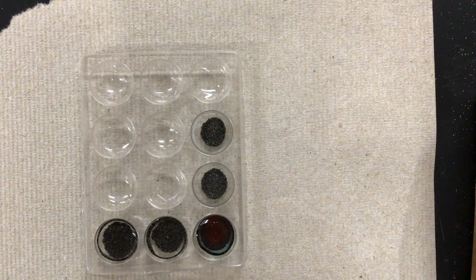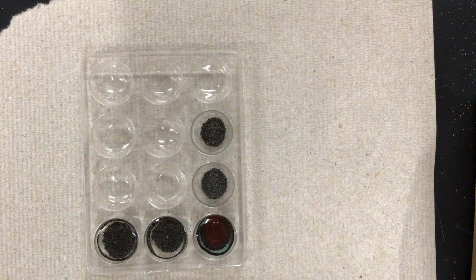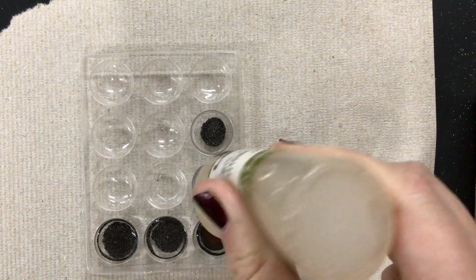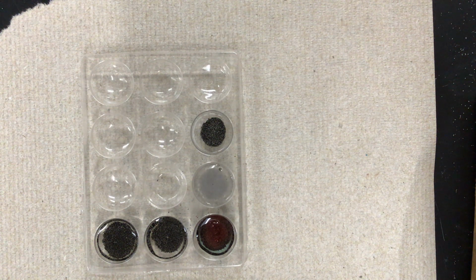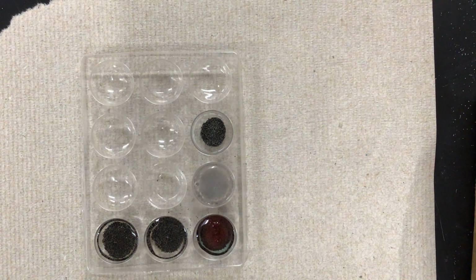The next one is hydrochloric acid, which is HCl. Let's see what happens here. As you can see, there's a lot of bubbles, so there is a gas being produced. It started reacting pretty much right away. There's a new gas being formed, and that gas smells terrible. It smells like rotting eggs. You can even put that down in your data table as evidence because it smells terrible.